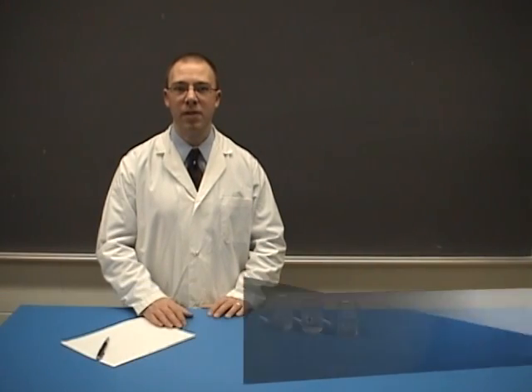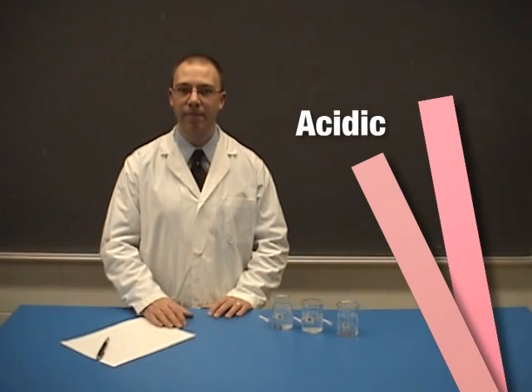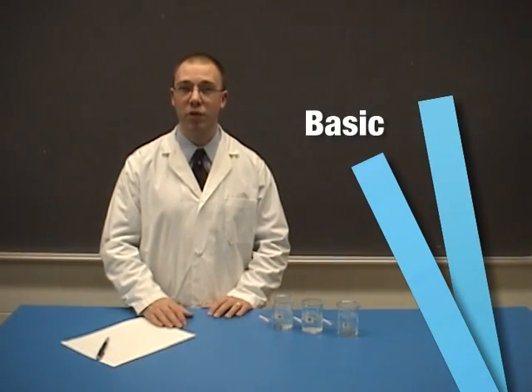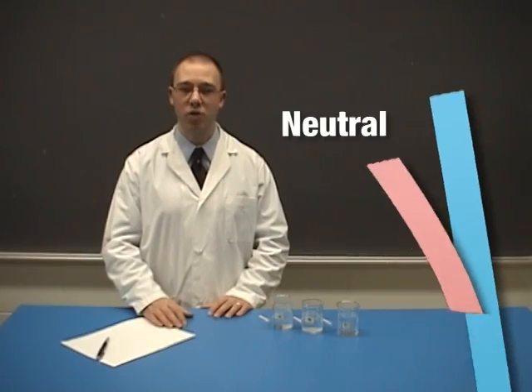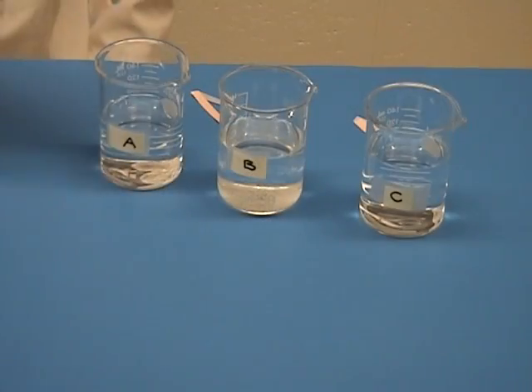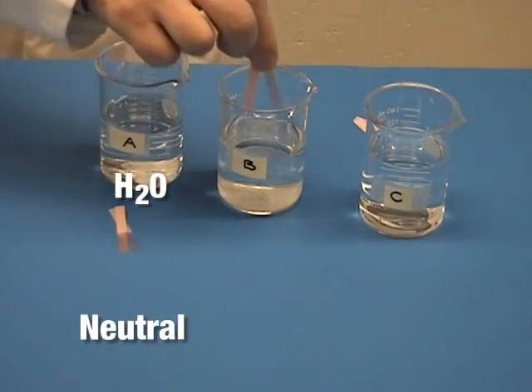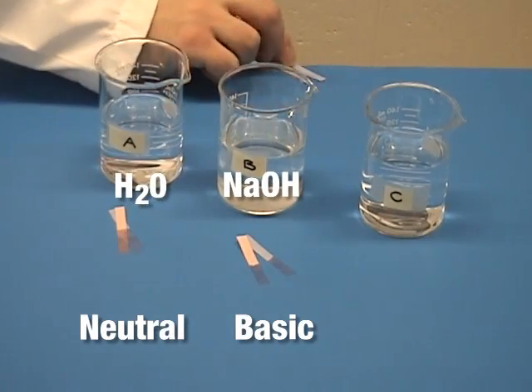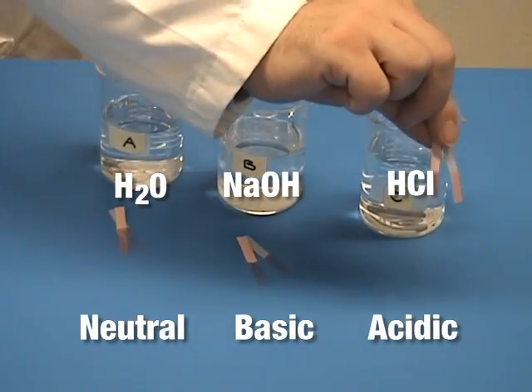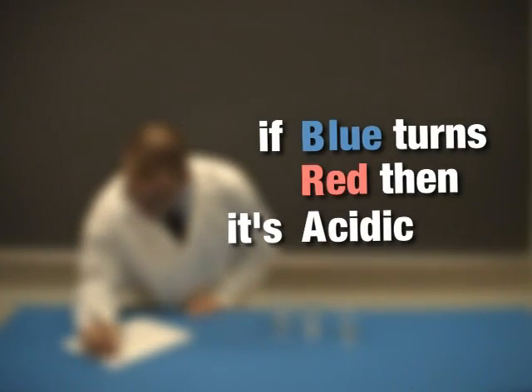Test 2: Litmus paper. Bring the red and blue litmus paper into contact with the liquid. If the blue litmus paper turns red, the solution is acidic. If the red litmus paper turns blue, the solution is basic. And if the red and blue litmus paper remain their original colors, then the solution is neutral. A memory trick is BRA — blue turns red means acidic — to help you remember how to interpret the litmus test.